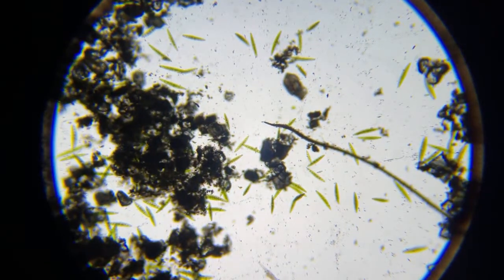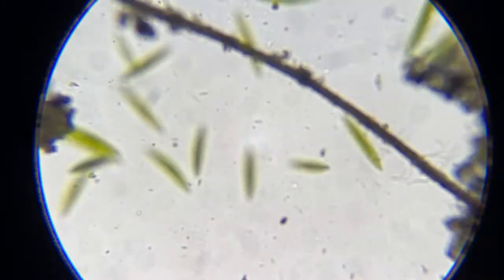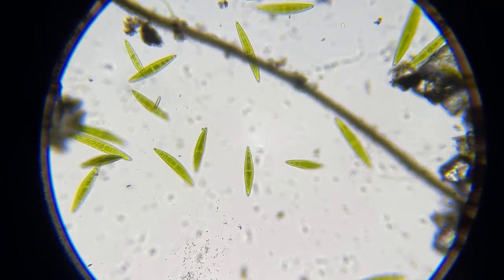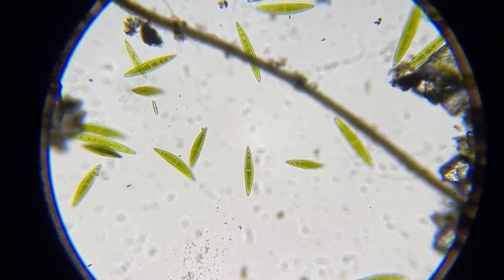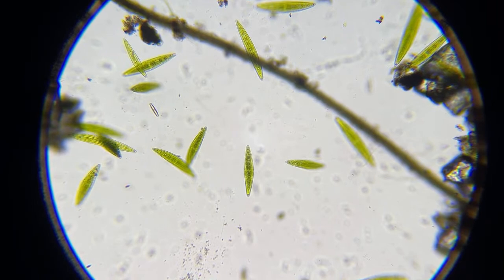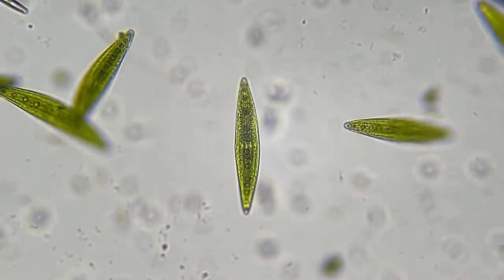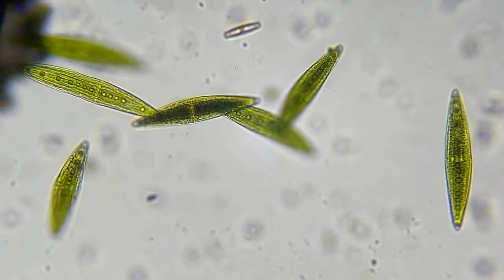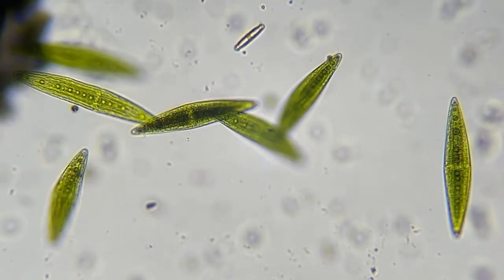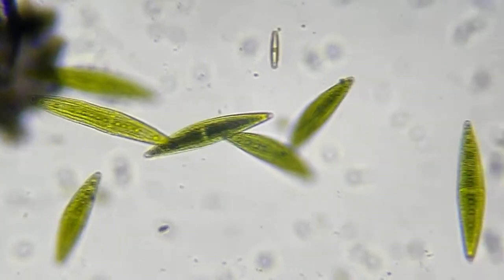All those green things right here, while we're in the neighborhood, that is algae, a kind of algae. And those are called Closterium. They're pretty cool to look at. But usually when you have Closterium in your water, it usually means your pond or your mud puddle is not polluted. You want to see some algae growing.